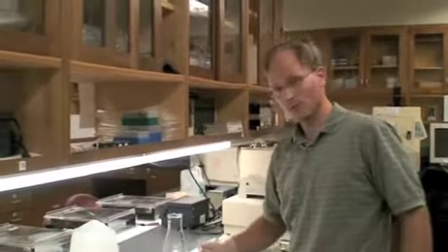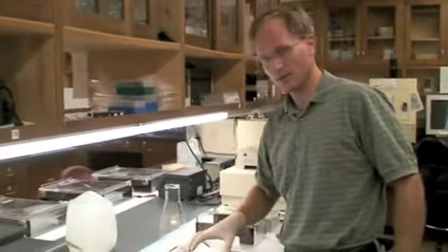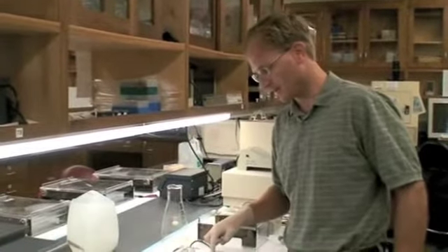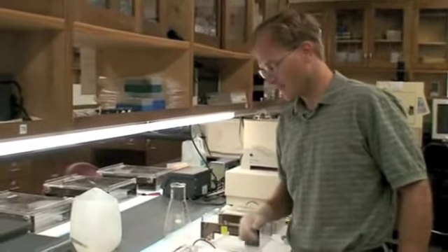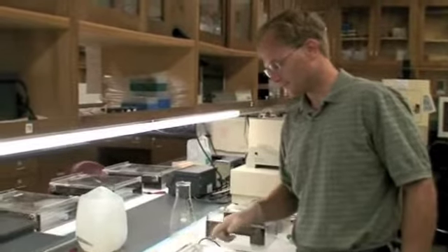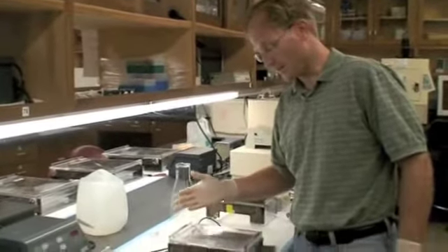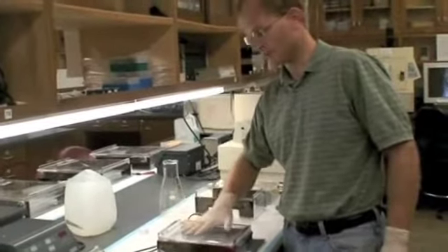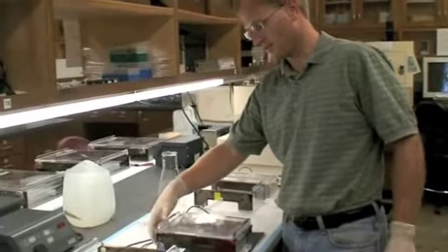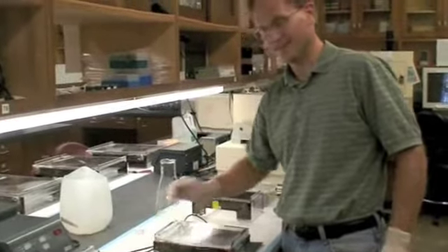If it had run the wrong direction for 40 minutes and I waited 40 minutes, there would be no blue stream. There should be a blue line across midway through the gel. If I waited that long, it was running in the wrong direction, and there wouldn't be anything on the gel. And this chamber, in fact, would have a tinge of blue to it on this side.